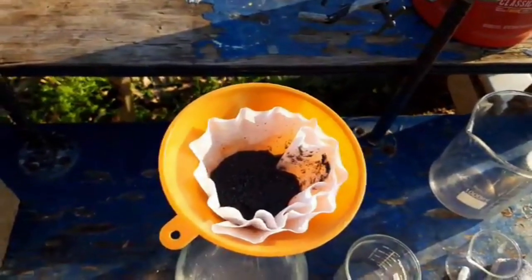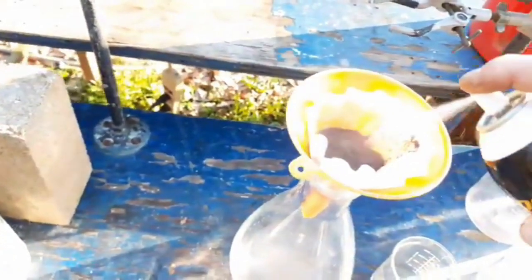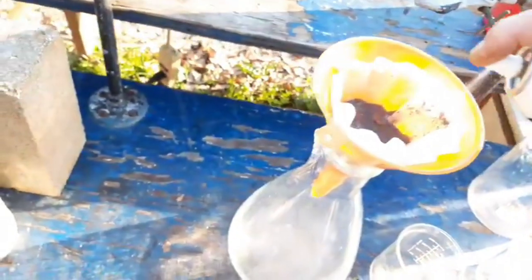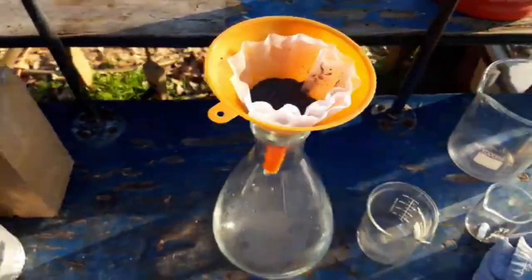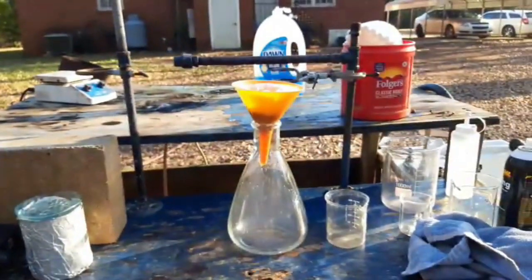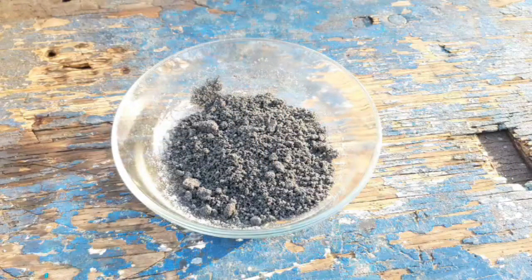Let's lay this out and let it dry. Should we give it another little spritz? Let's just give it a spritz. Nice little spritz. The ether fumes have no effect on me. The paper says that we are supposed to end up with a dark reddish-gray compound. I could imagine that this is that — I would have expected it to be a bit more reddish.